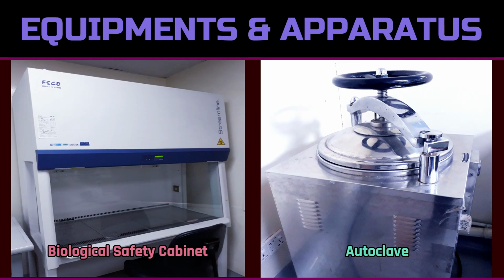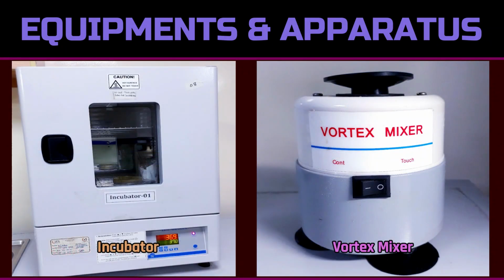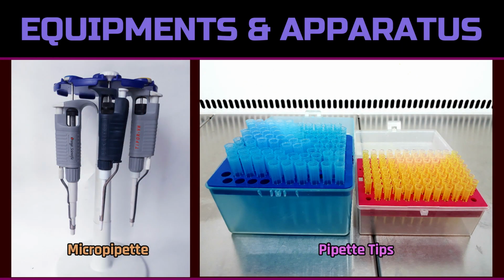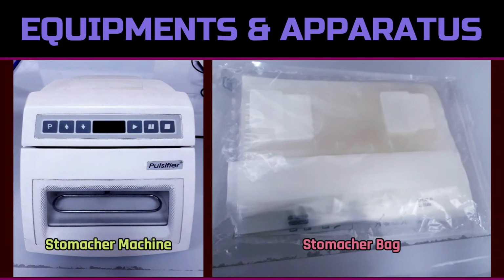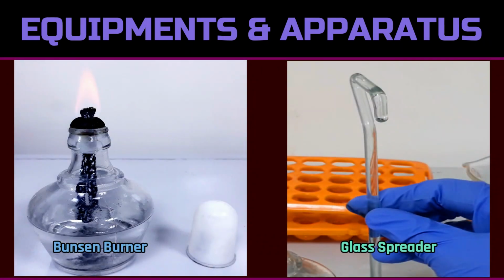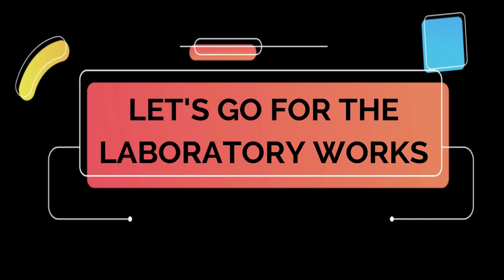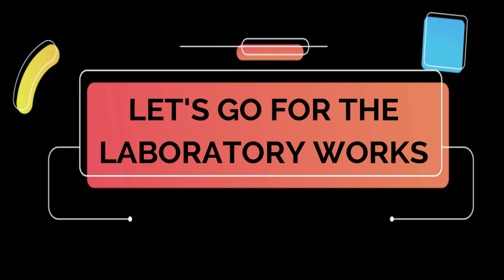To perform this analysis, we will need several pieces of laboratory equipment including a biological safety cabinet, autoclave, incubator, vortex mixer, balance machine, chopping board with knife, micropipette and tips, stomacher machine and bags, Bunsen burner, glass rod or spreader, as well as the necessary media and reagents like Baird-Parker agar, sodium chloride, and 2-propanol. Now, let's move on to the laboratory work and begin this analysis.